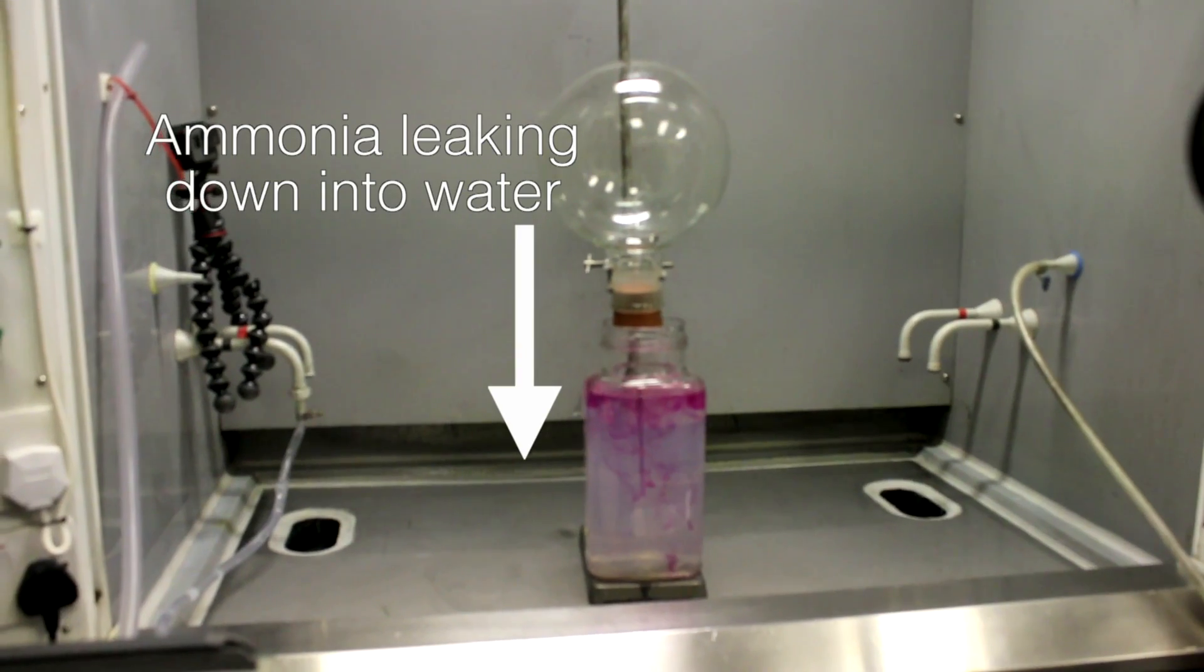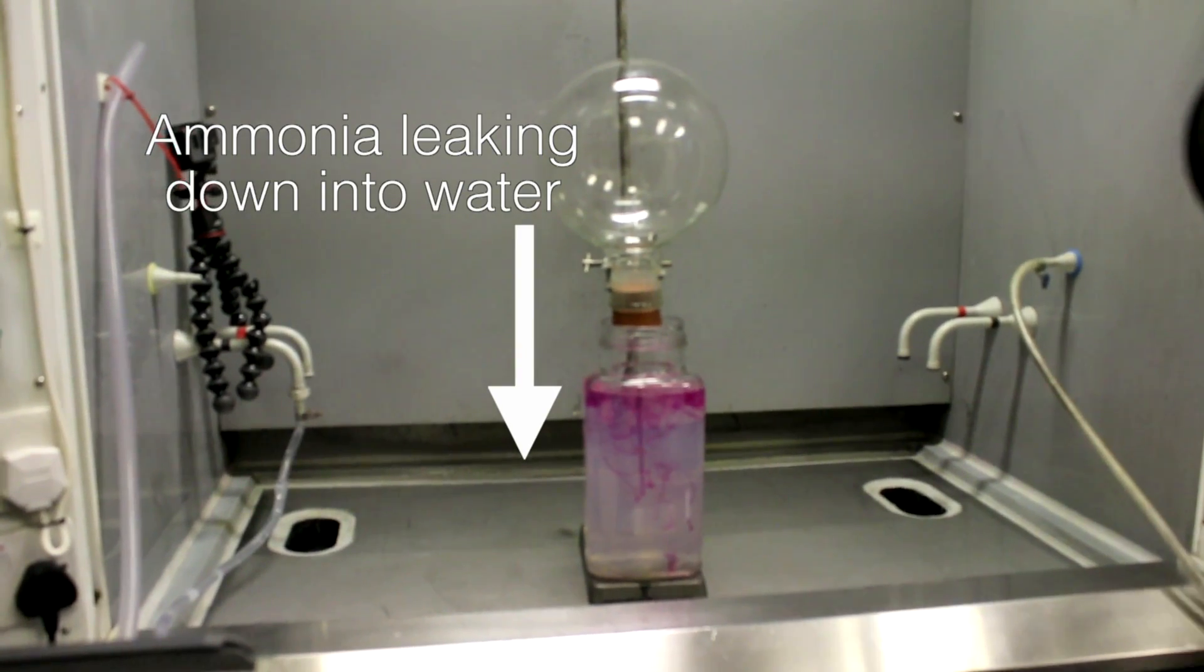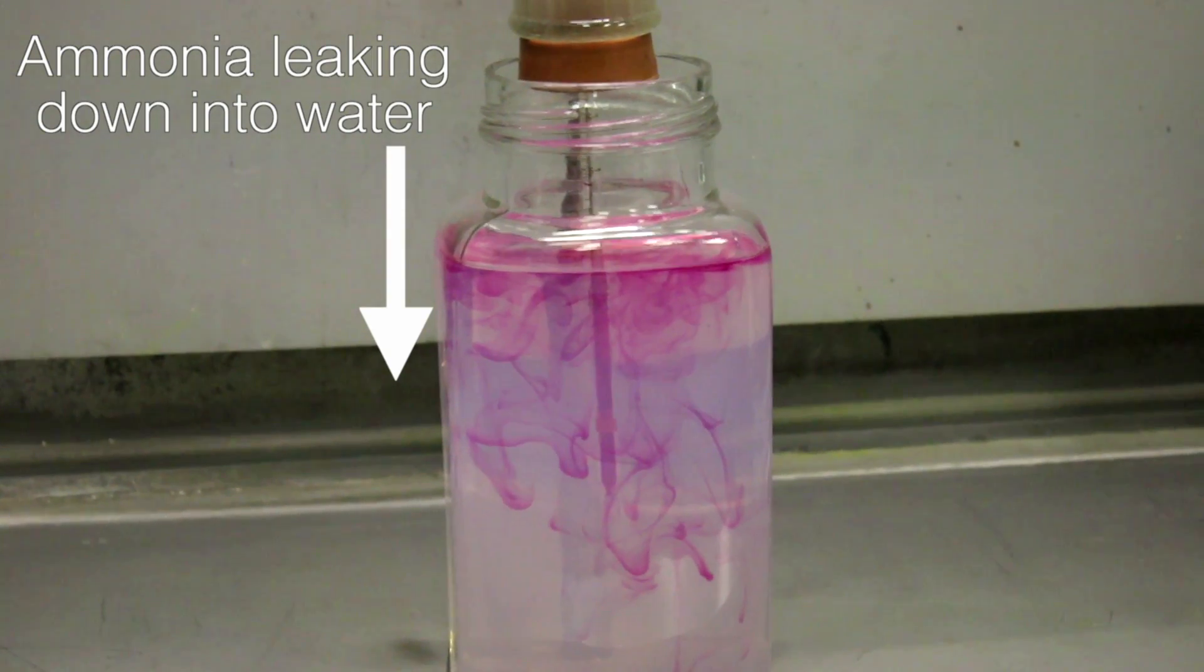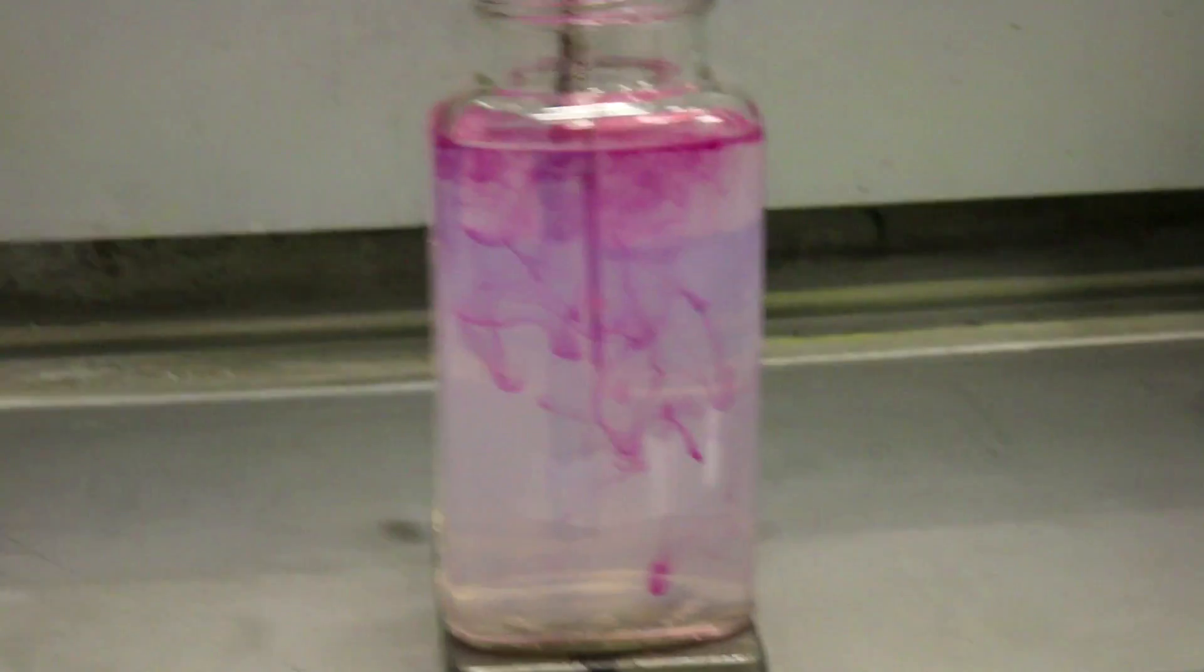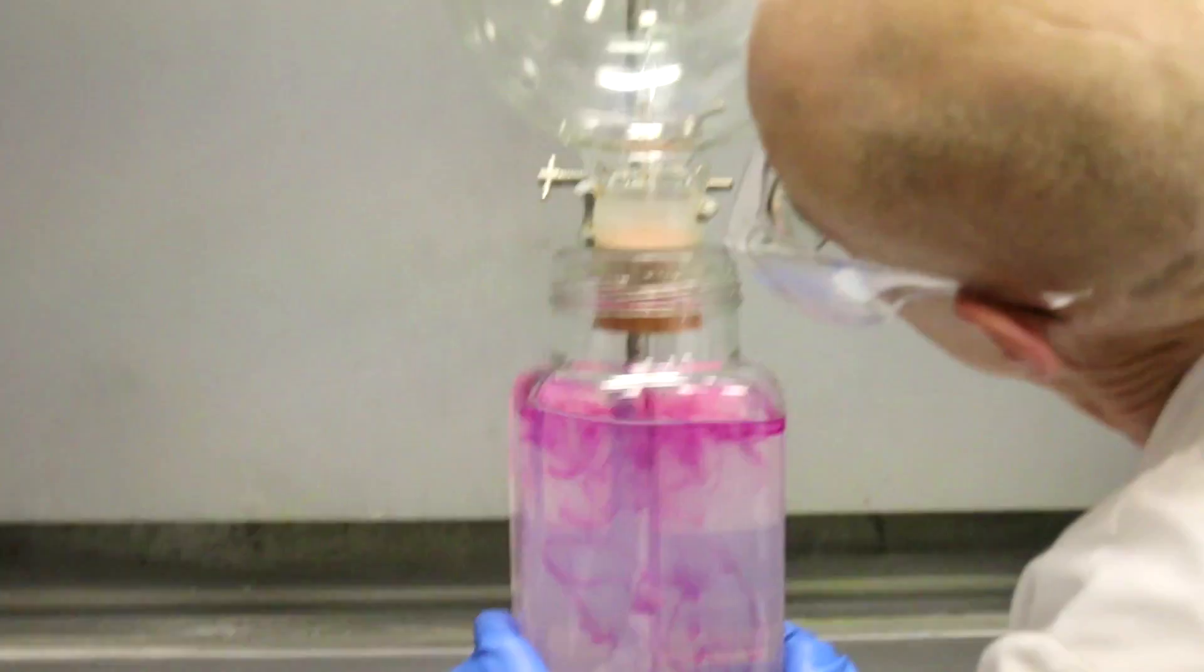Enough ammonia was coming out to start triggering the indicator, and the most beautiful red threads started appearing in the jar. I was so excited I nearly wanted to stop there.